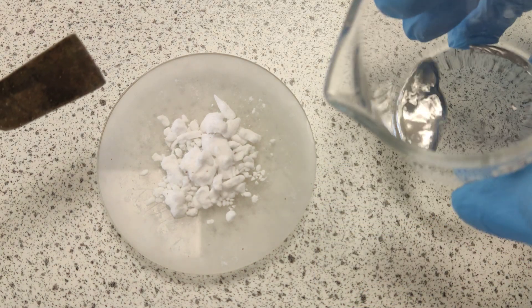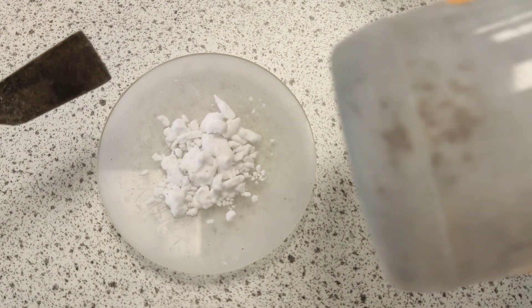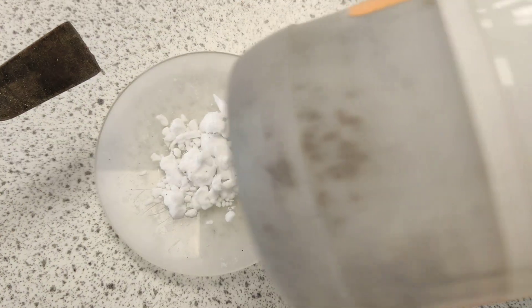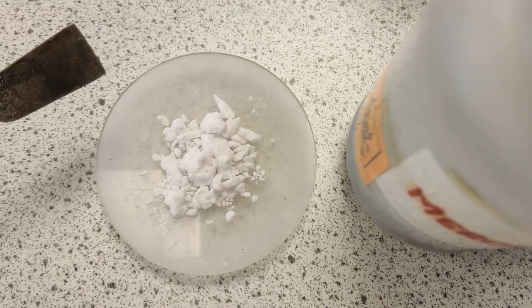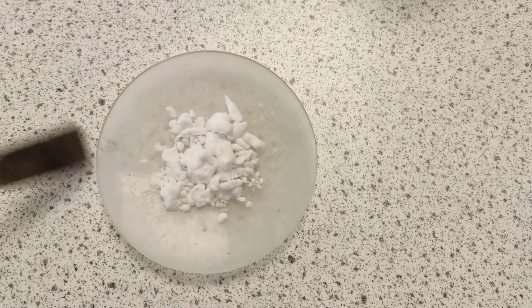So when I pour, I've obviously got a lip on the beaker there — I'm going to pour back in. Look at this: this is a large bottle of liquid mercury. Pretty heavy stuff. It's huge, but it's in plastic. And this is steel.